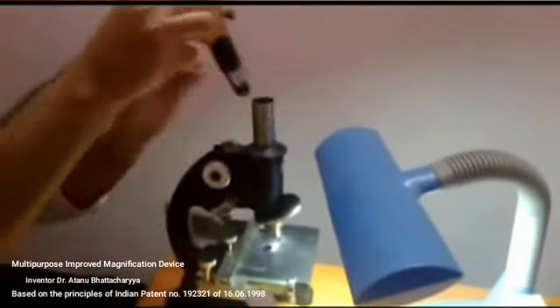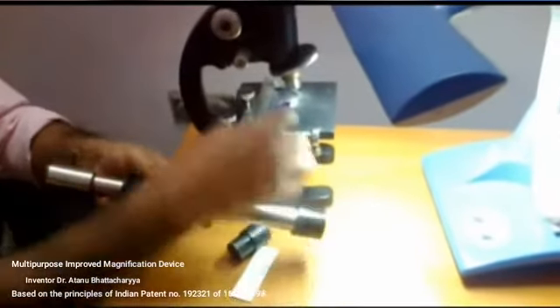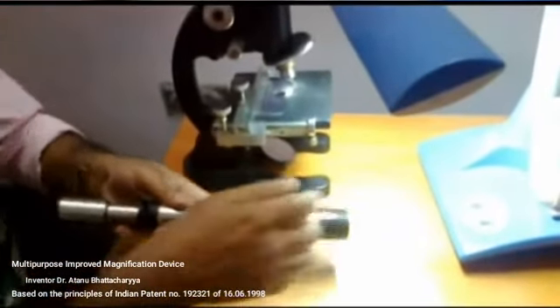Now, what is the principle about the field microscope? Actually, the field microscope, the principle is same. Here, this is the objective, like it. This is the objective.